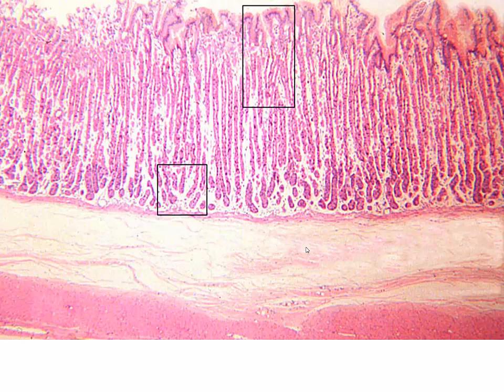So again, as we get a closer look at the stomach, we can see our pits that extend from the surface down to approximately this region. And then we can see these long tubular glands that comprise the gastric glands. And this is going to be in the body or the corpus of the stomach. And you can see how they extend all the way down through the lamina propria down to the muscularis mucosa.